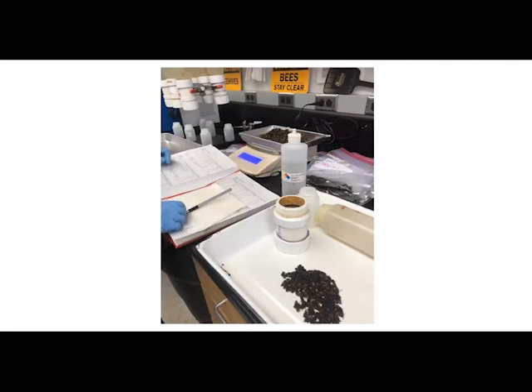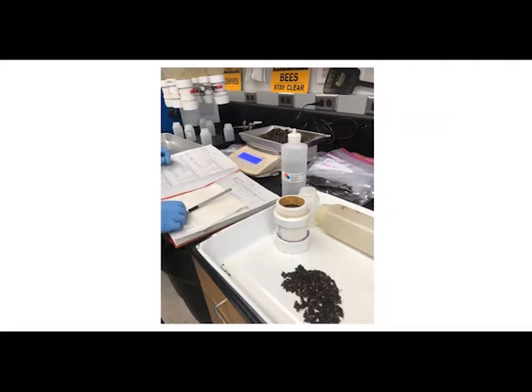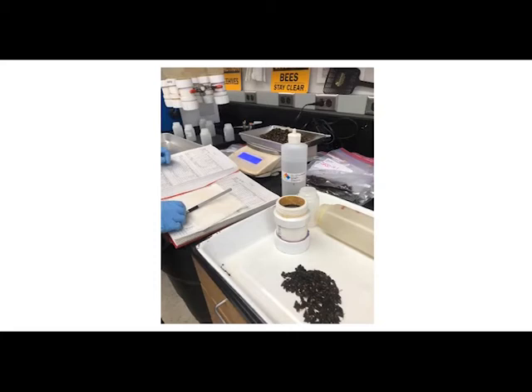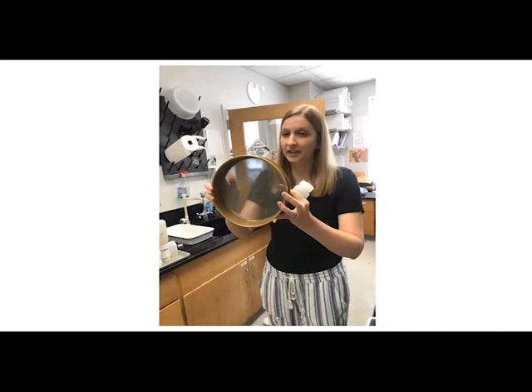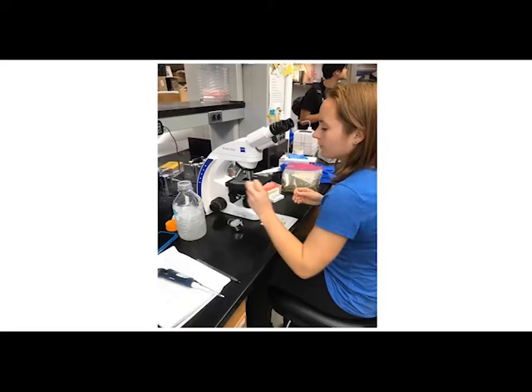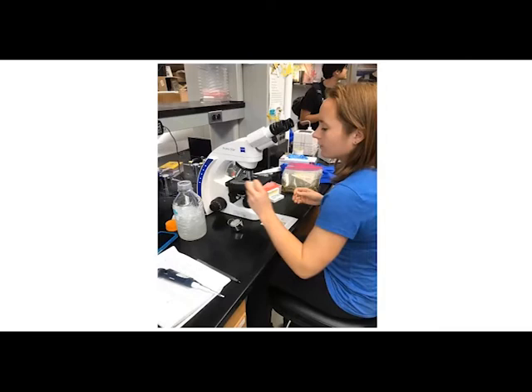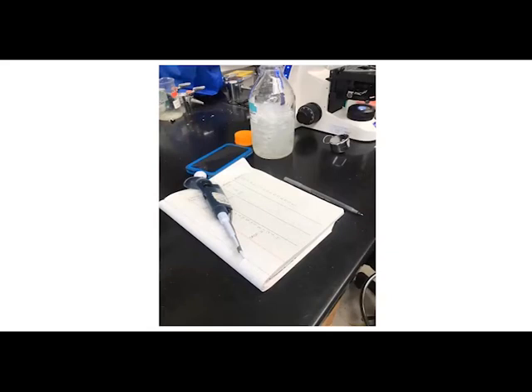You can see our data book, where we record all of our data. When we find mites, we record those numbers. We also count the bees so we know exactly how many bees are in each sample, to report accurate data to the beekeepers. We also bag up samples, and we actually crush those bees and look at them under the microscope for a parasite called Nosema. Nosema is a unicellular gut parasite that basically gives bees diarrhea and makes them sick — another thing our lab looks at.